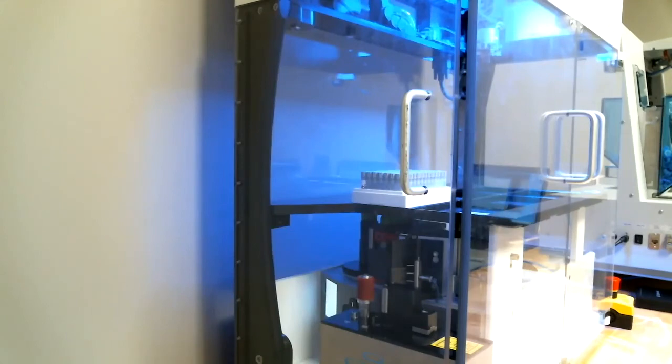Another thing, so you can add tubes at a later date. You don't need to have the unit set up for the exact tubes you're using whenever you would order a unit. Down the road, if you decide to go to a different tube type, completely fine and easily added on at a later date. The last thing, so daily maintenance.